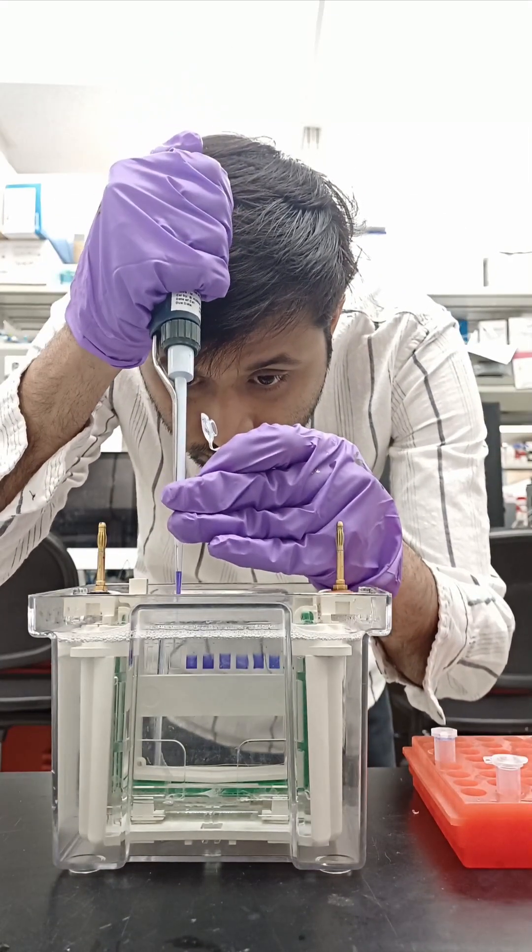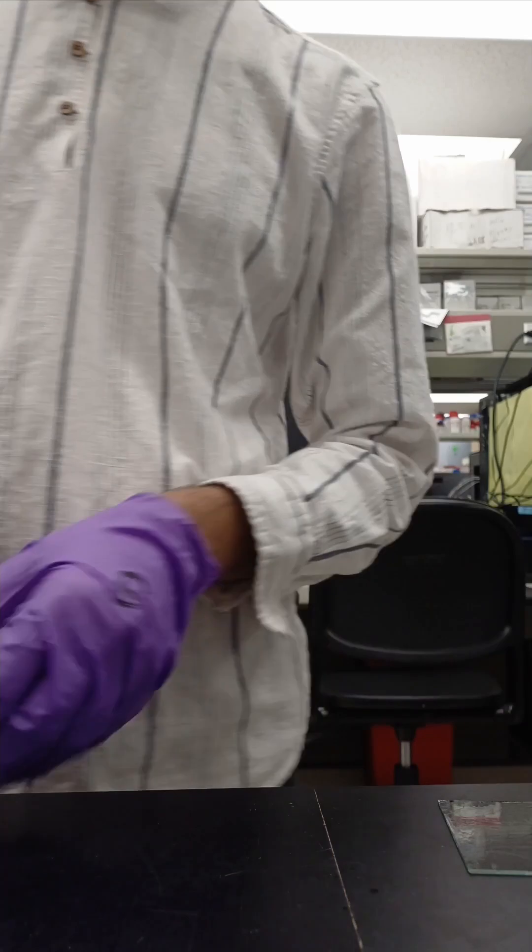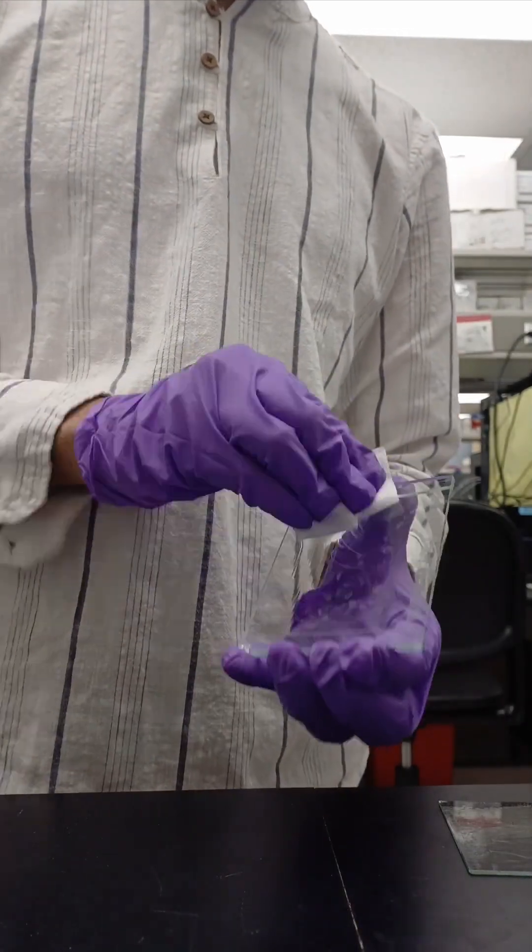Let me show you how to set up and run an SDS-PAGE gel. First, always clean the plates before and after use. It prevents leakage and keeps them in good shape.